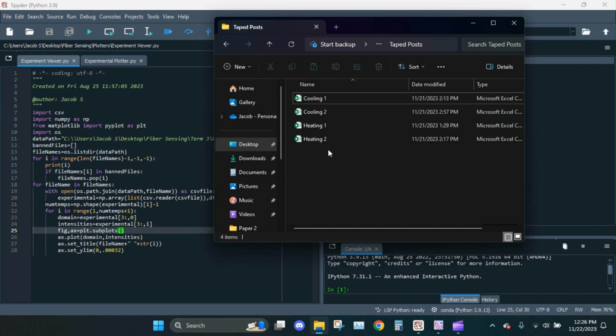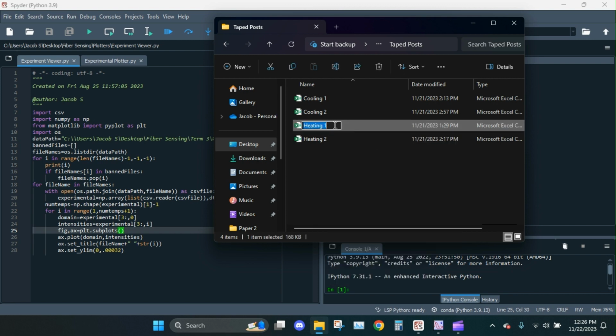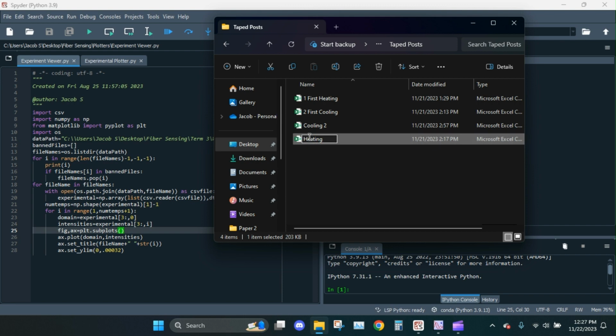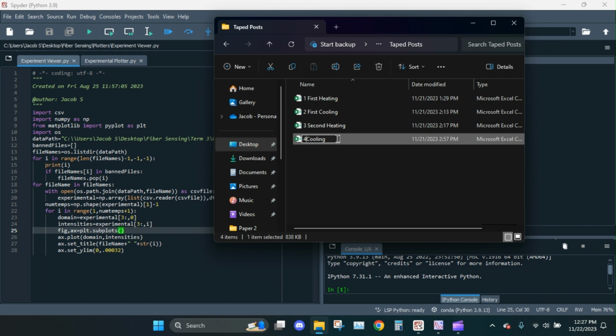spreadsheets. First thing I'm going to do is rename these to put them in the right order. The program's going to open them up in alphabetical order, but I could just number them 1, 2, 3, 4 in the order I want. So heating ones first. So where is rename? I'm going to call it 1, first heating. And then the first cooling is going to be 2. Second, the third one, and 4.